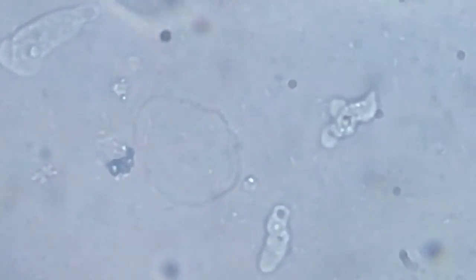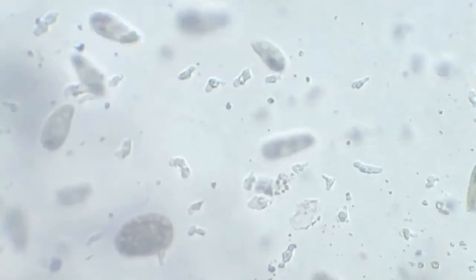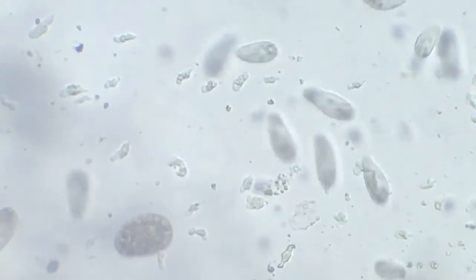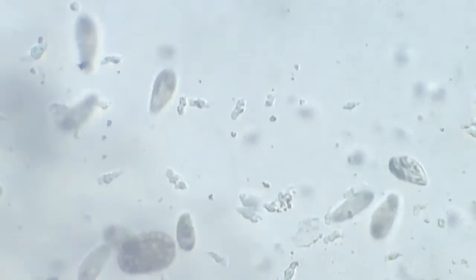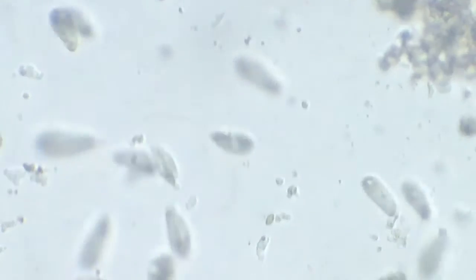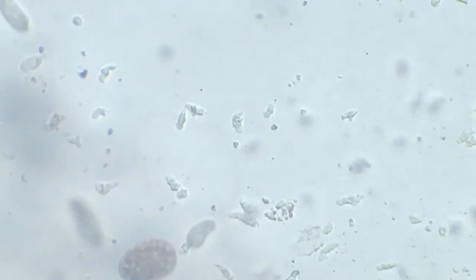We go back to a lower degree of magnification now. We'll go to the 10x and see what we get. At 10x, this is how you come across amoeba. This is how they look. They're all moving towards whatever remains of this particular dipteran.